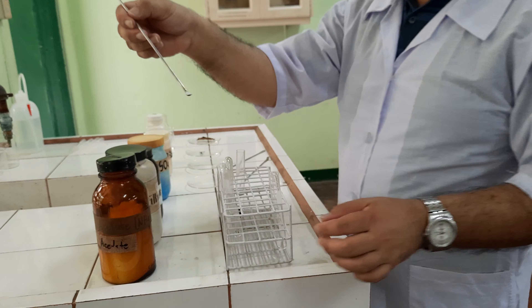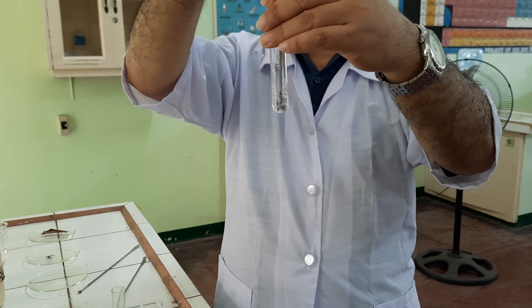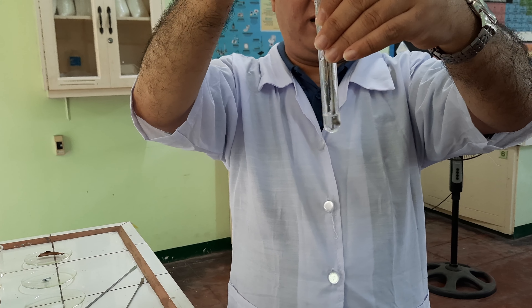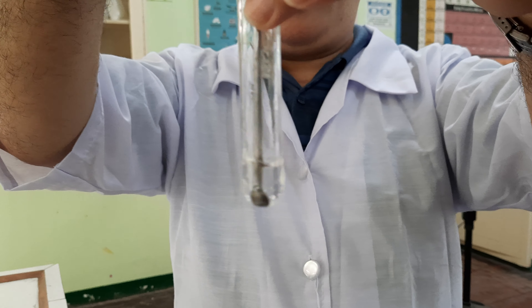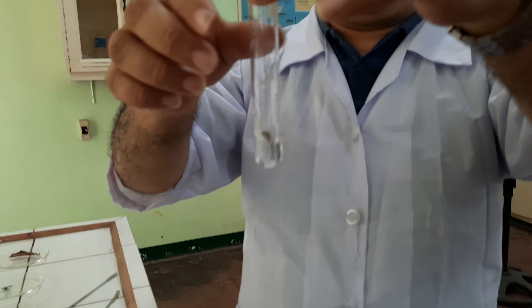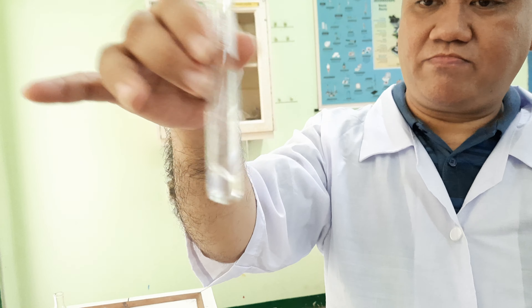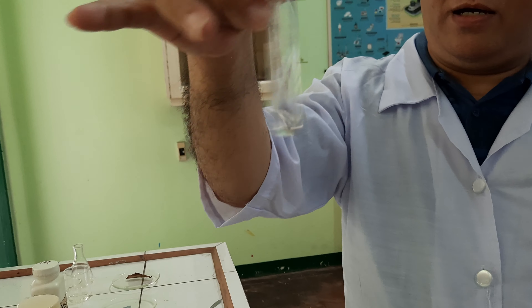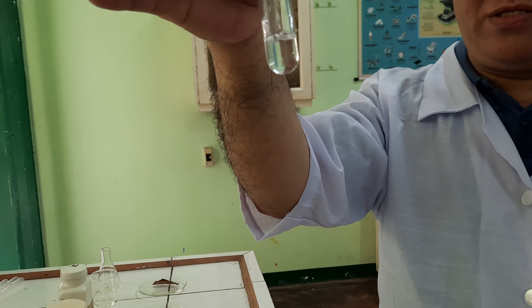Okay, these are the sugar crystals. 2 ml of water. Let me stir it. What have you noticed as we mixed the crystals of sugar with water? What happened to the sugar crystals as it mixed with water? Where are the sugar crystals now? Record your observation. Next procedure.